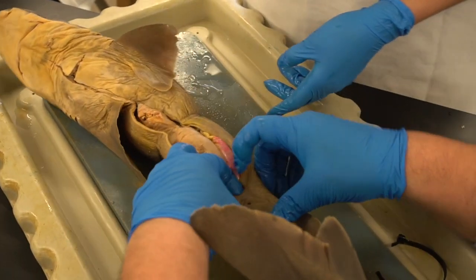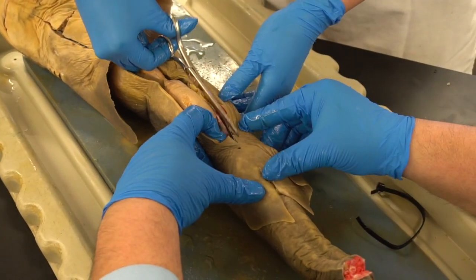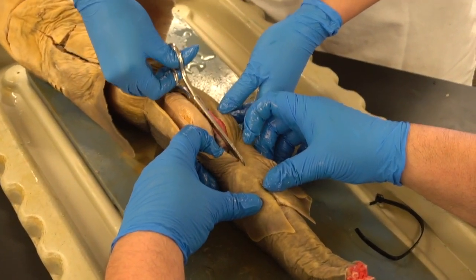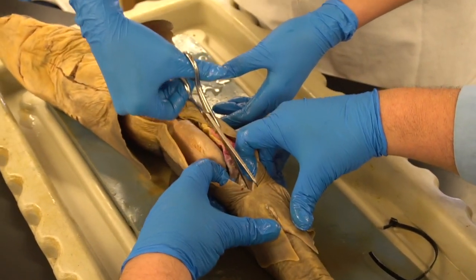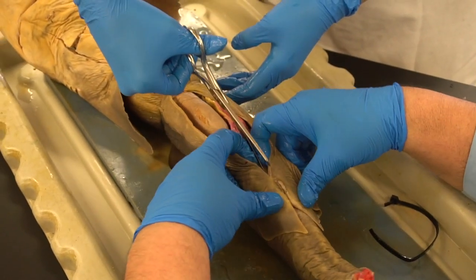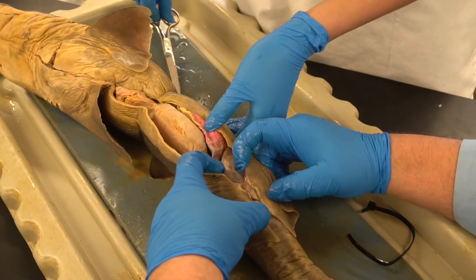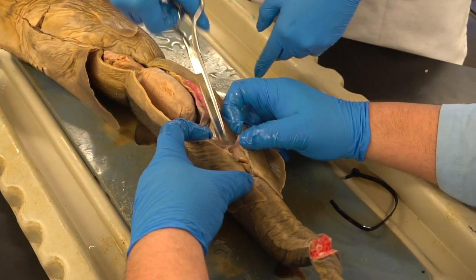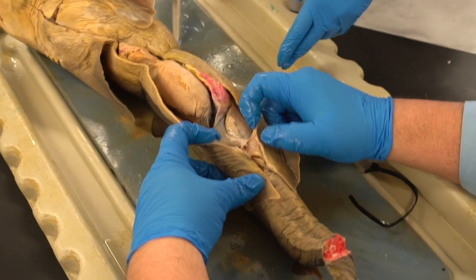All right, so we want to get through this. Similarly, cut the body wall as you did before. Once you get a start on this, you can get your fingers in and you can help. That's it, right there. One more, just a little bit right there. Now we open that up so we can now see. Just that one little top part. That's it.